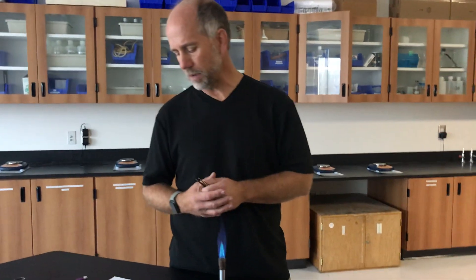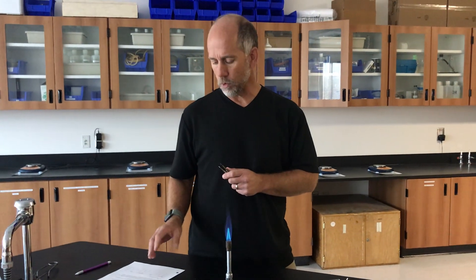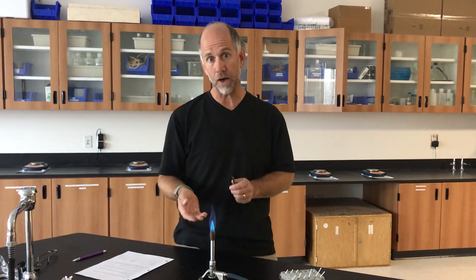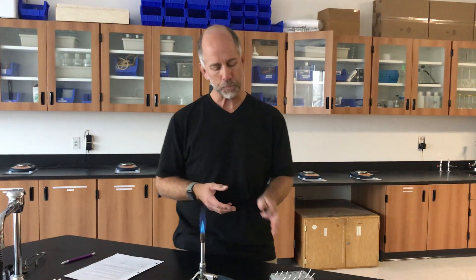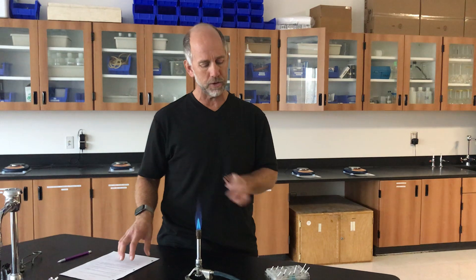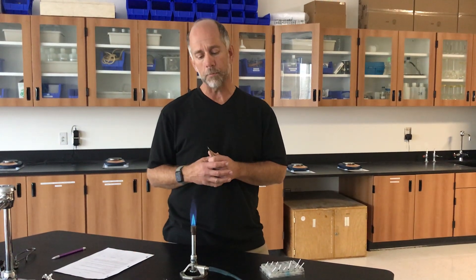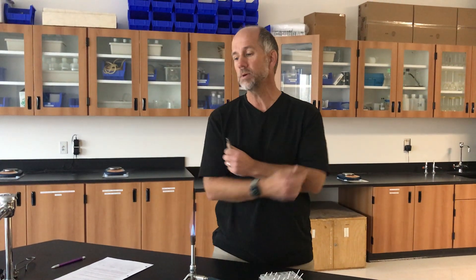Now that you've had the opportunity to observe the flame test colors for those seven elements, we're moving on to step six. In step six of the lab, you're being instructed to access three unknowns, lettered A, B, and C. Each of these unknowns contains one of the seven ions that you already flame tested. You will be asked to identify what these unknowns contain based upon their flame test colors and comparing them with the colors that you already observed. You can use your color descriptions in your data chart as a starting point, or rewind this video to compare color to color.